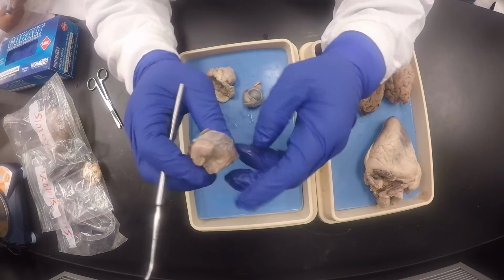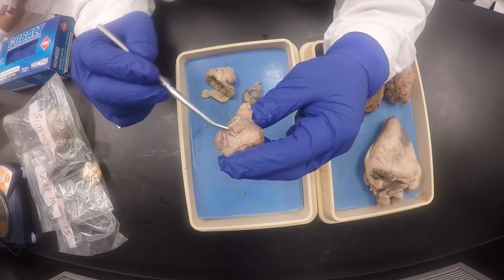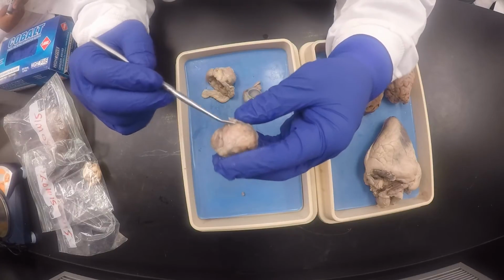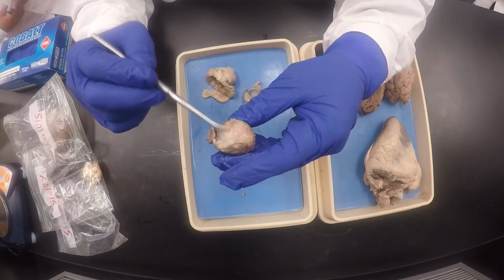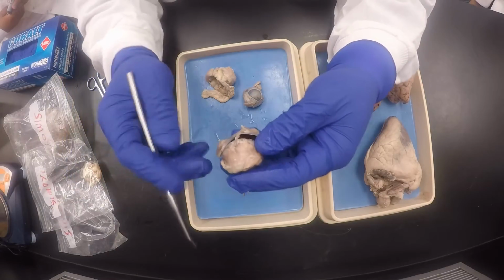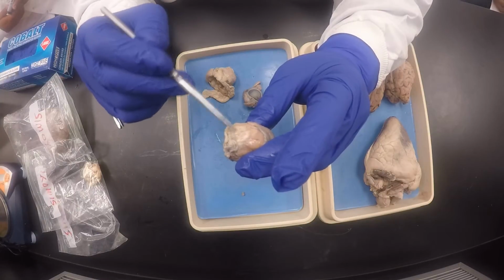But then there's a seventh muscle in this sheep eye. See, there's our superior oblique right there. We scoot that to this side. You remember I was careful not to cut them. There is the retractor bulbi. Okay, you're done. Retractor bulbi right there. And there's the optic nerve right there.